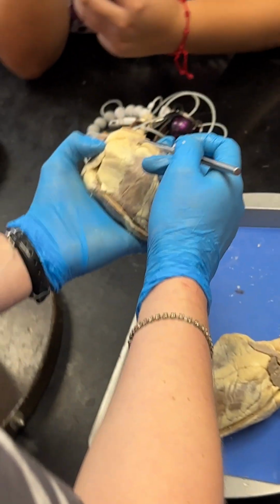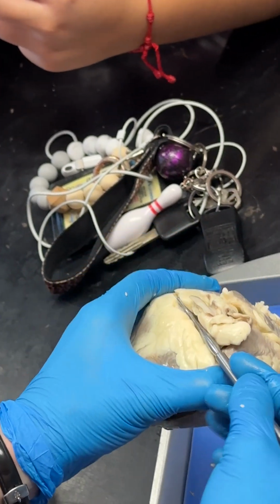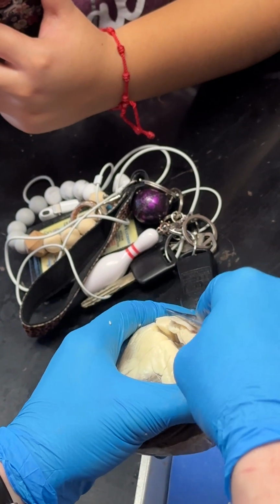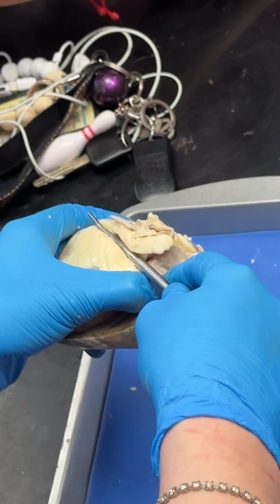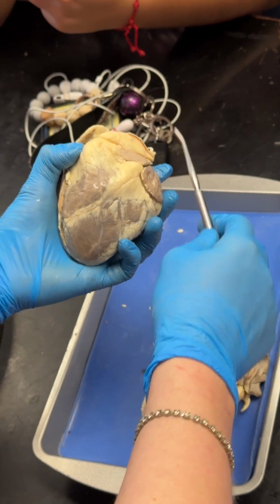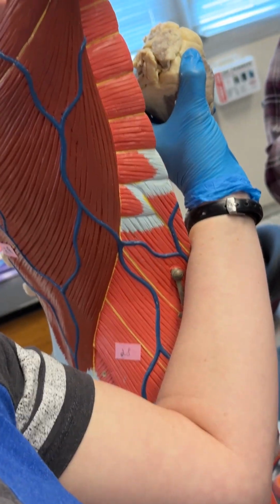If you find the pulmonary trunk here, the coronary sinus is basically a blood vessel that sits in between the ventricles and the atria. So it just sits in here. In the back, right? Yes, it's on the back side. So the pulmonary trunk lies in the front. Yes, the pulmonary trunk is on the front, or the anterior. So this is in a heart facing that way. Yeah.